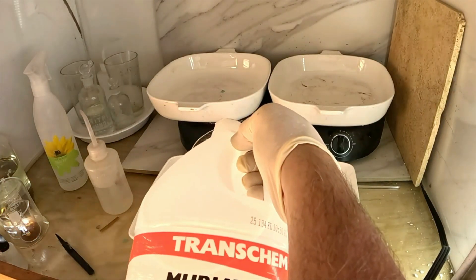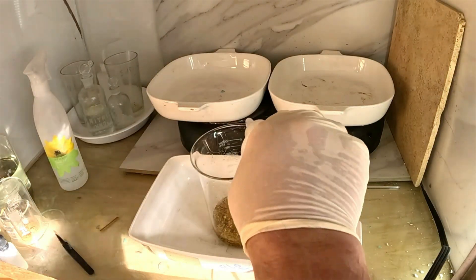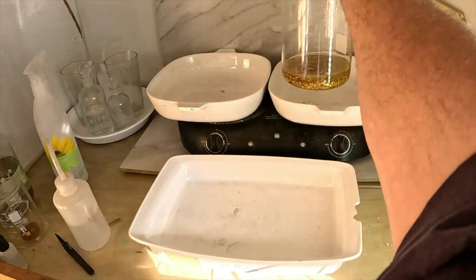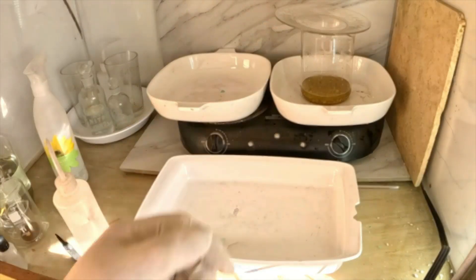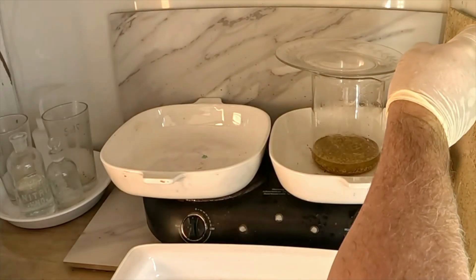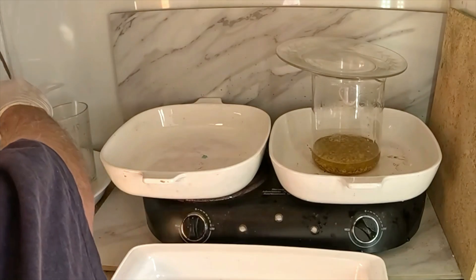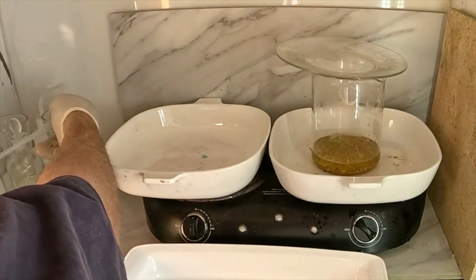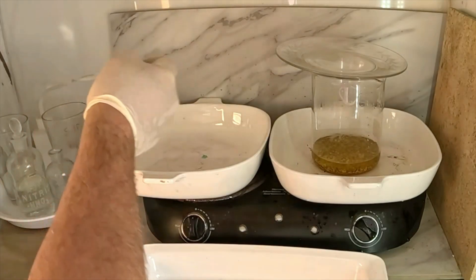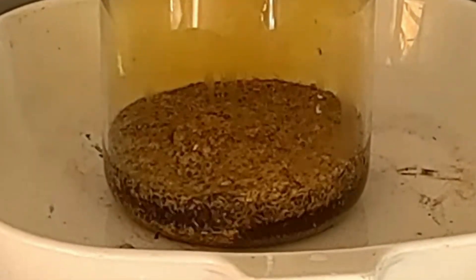We're going to mix hydrochloric acid and nitric acid. We'll start by topping off the foils with hydrochloric acid and putting this up on the heat. We're going to add a small amount of nitric acid to form our aqua regia, which will dissolve the gold. I'm also going to add a little bit of sulfuric acid, which will precipitate out any lead that might be present. The aqua regia reaction is fast and dramatic, and the red-yellow color that results in the solution is the color of gold.